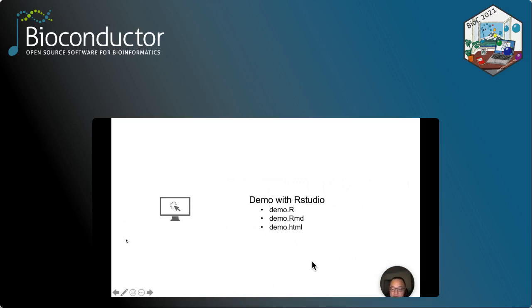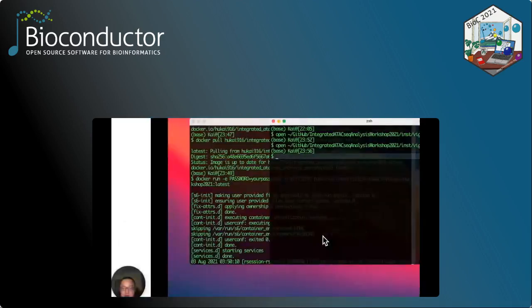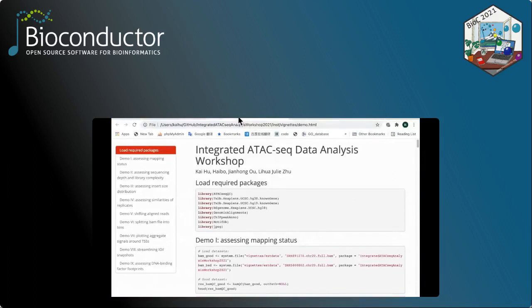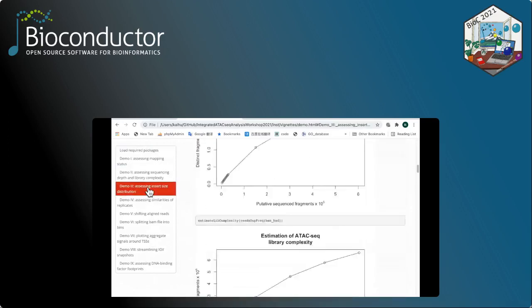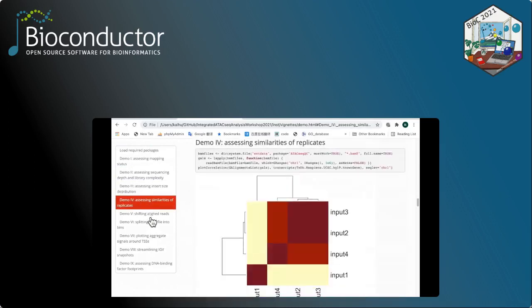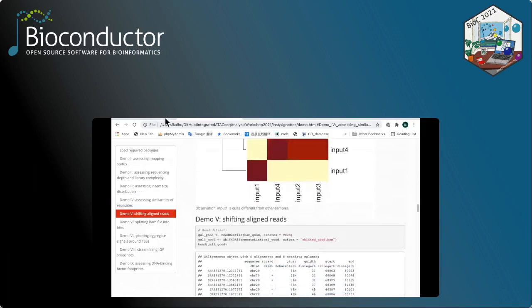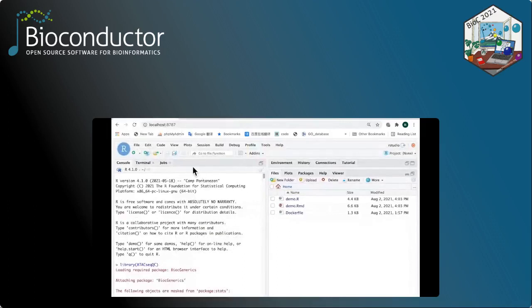Okay, for the demonstration, I prepared several files that you can refer to. All the plots can be generated with the demo.r file. And I'm going to show you what the demo.html looks like. So first I can open the HTML file. As you can see, there are 9 demonstrations in this file. You can browse through each of the demonstrations. You can see the code, the results, and some comments about the results. Okay, now let's go back to the RStudio.